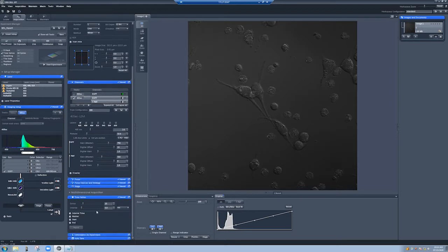And what we need to define is something very basic. How many images we want to take and how spaced apart we want them. So for example, I could say I want to take 5 images and I want to take them every 5 seconds. So let's try that. Let's first go to live.